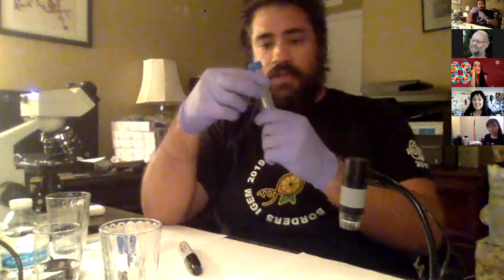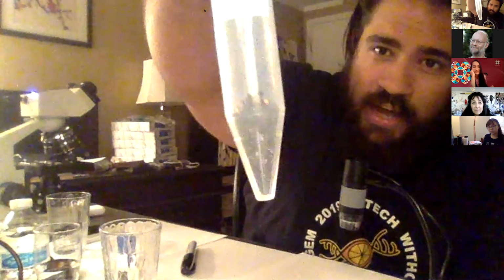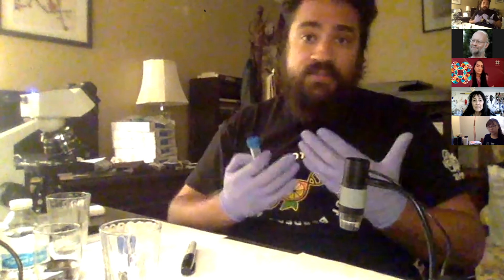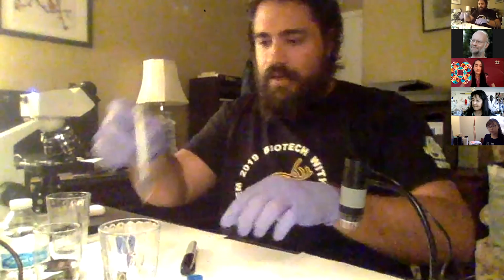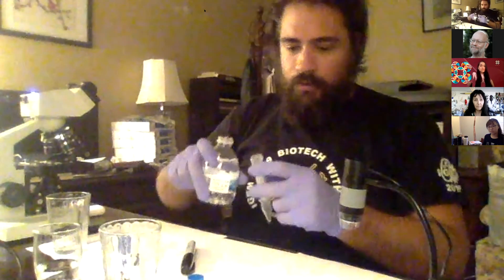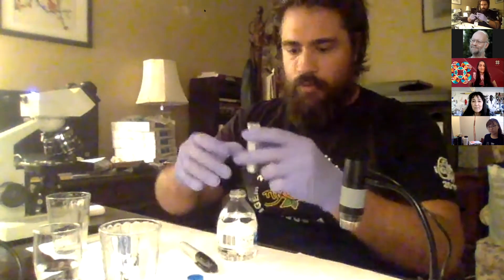All right, so first things first, I got my nice little sample here. I have a 15 milliliter centrifuge tube, and I've got the sample of soil filled up to roughly 1.5 mil. So we have basically 1.5 grams of soil. I want to do a 1 to 5 dilution, so I want to add roughly another 4 mils of water. If you want to be super precise, you wouldn't eyeball it, you could use one of those plastic little squeeze pipettes. But because I'm a maverick, I'm going to eyeball it. Cool. All right, and we got it pretty much on the nose.